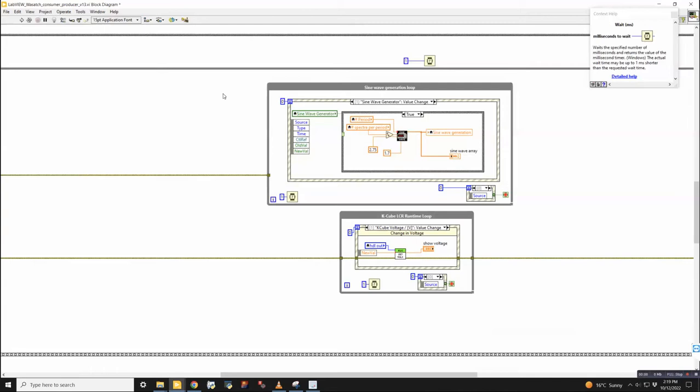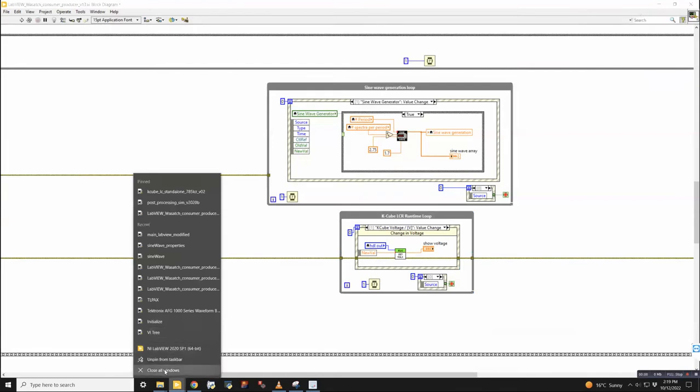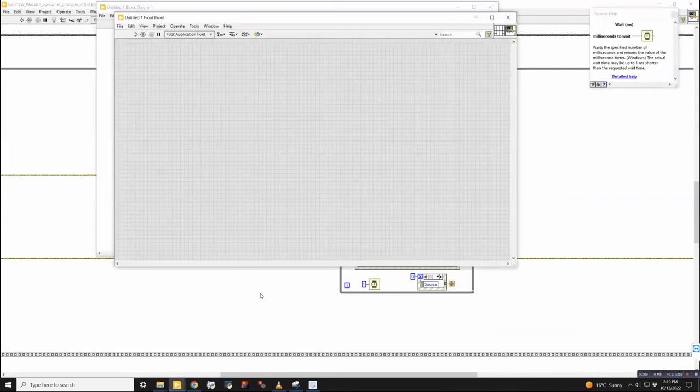So if we didn't have this wait set time, this is kind of the most complicated part to me. Everything would just run a lot slower because it's going unnecessarily quickly? Yeah, I can show you.